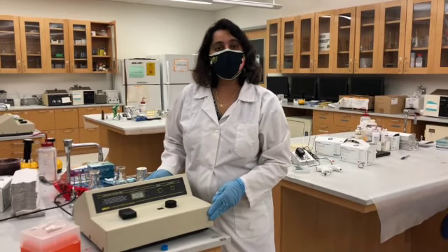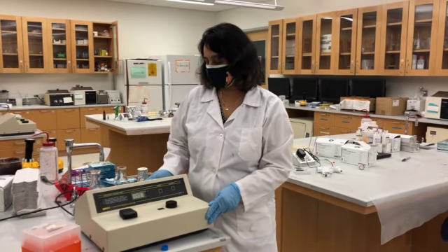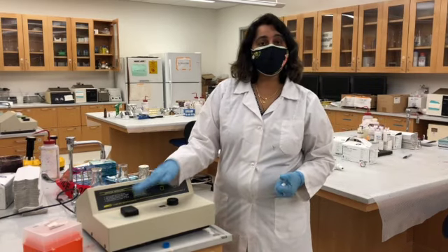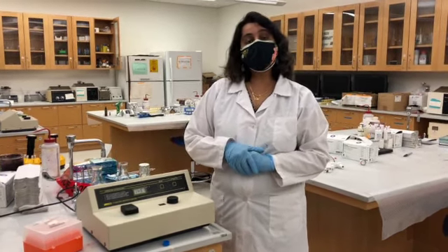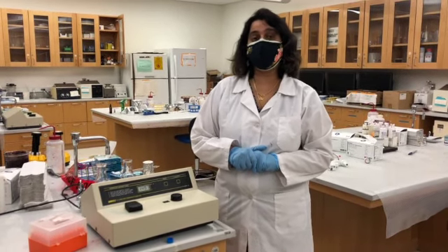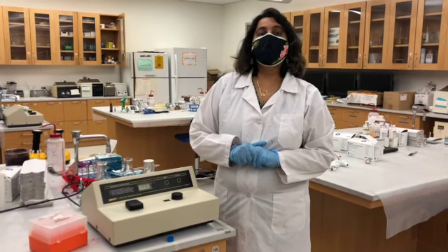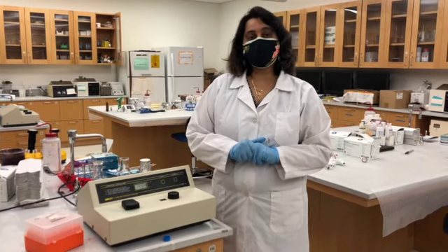But before we complete this exercise, I just have a quick question for all of you. Though we are tracking the growth of the bacteria using the spectrophotometer, we also need to make sure that the cells are actively reproducing and growing. Why do you think we need to do that? All right, I'm just going to pause for a quick 10 seconds and then give you the answer.